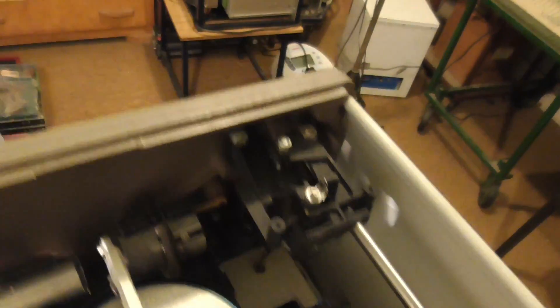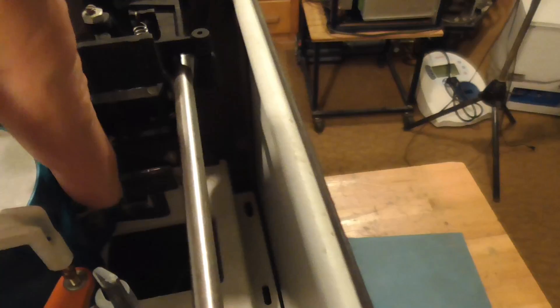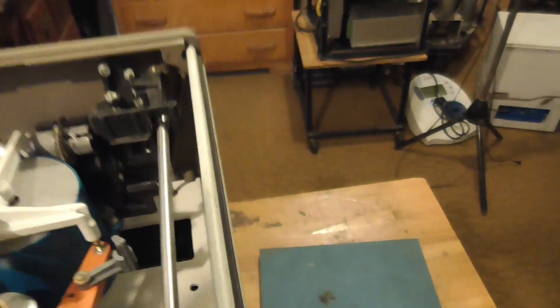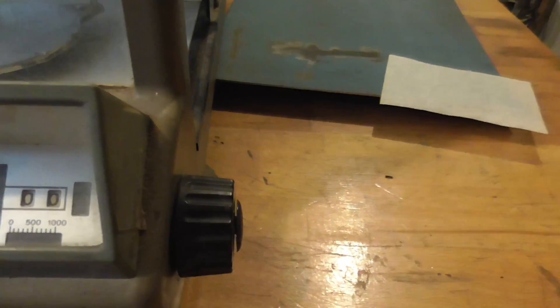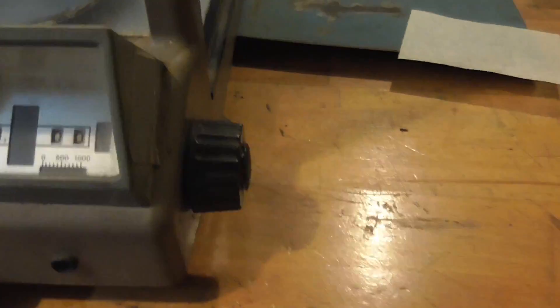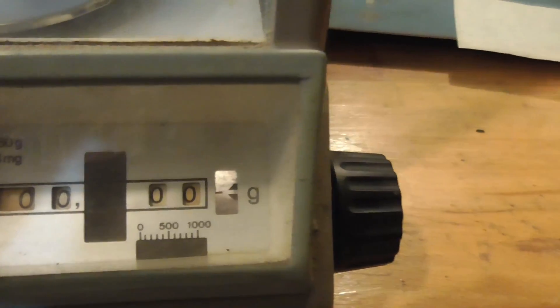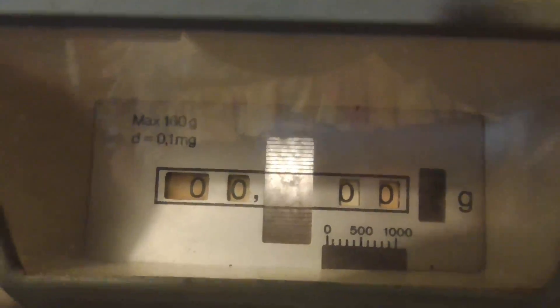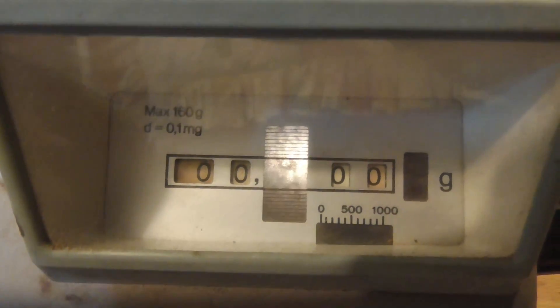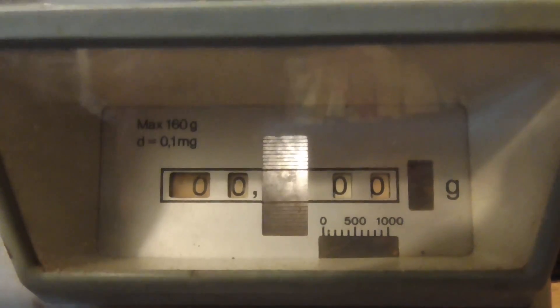And that is where that then is reflected over here, hits another mirror, goes down through the inside here, hits a mirror that's down in the base here, and that projects it this way, and it comes up and gets onto this scale. Here, this is the scale. Now, if you look inside here, it's out of focus. Let me go ahead and adjust it.